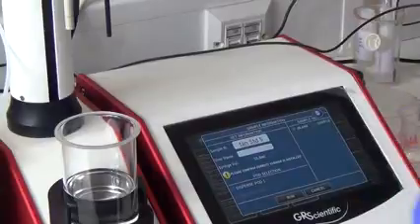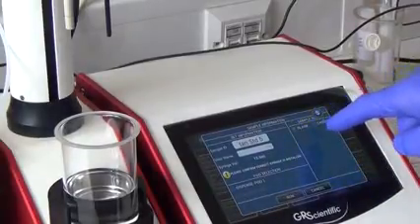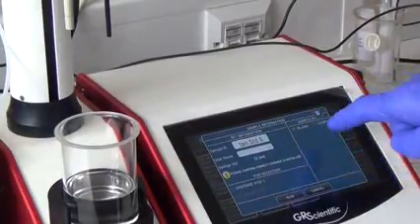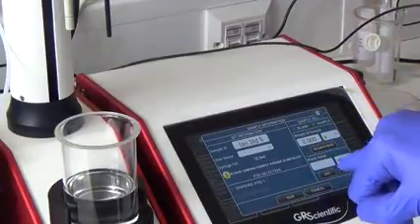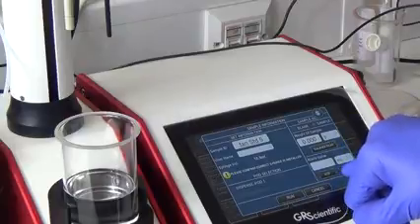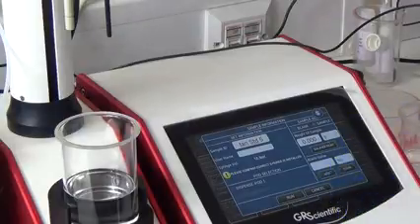We'll leave the username blank. And in this case, it's now our sample. So we need to activate the sample box. Our blank value, which we ran previously, which has been added to the variable function table, I'm going to add that in.